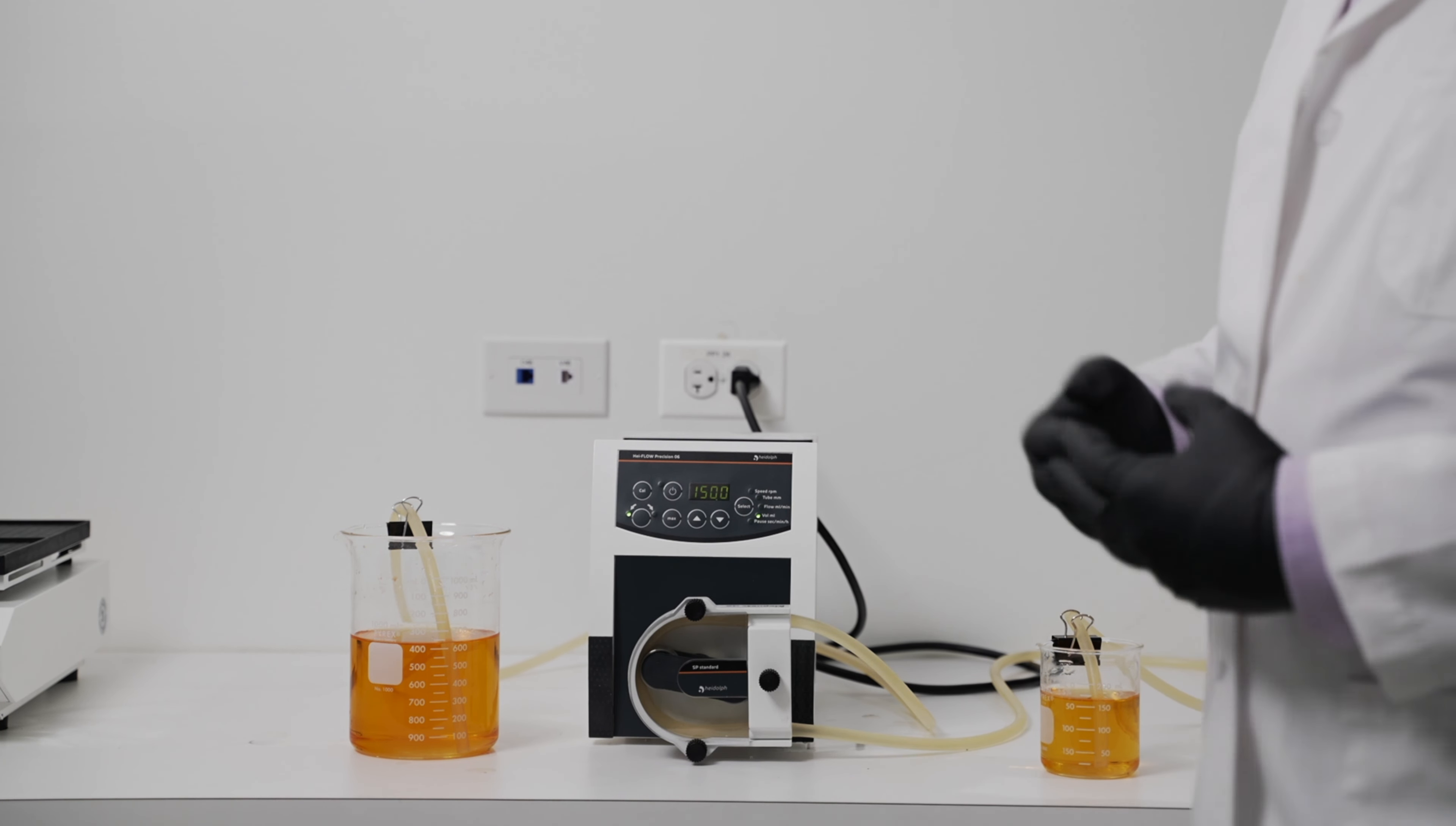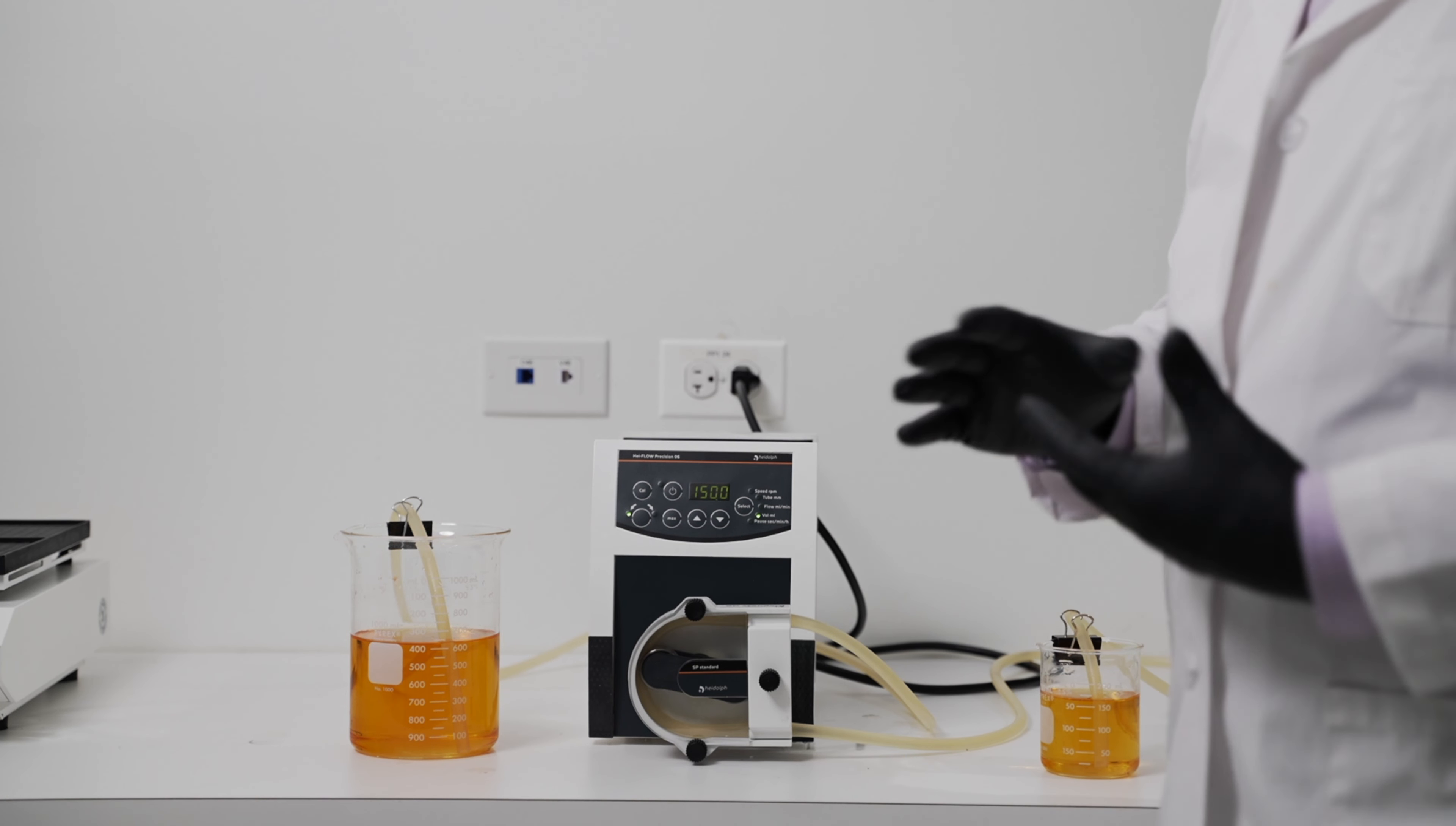I recommend doing this process two or three times just to ensure that you are as precise as possible.